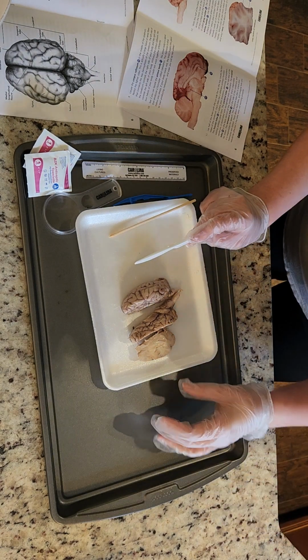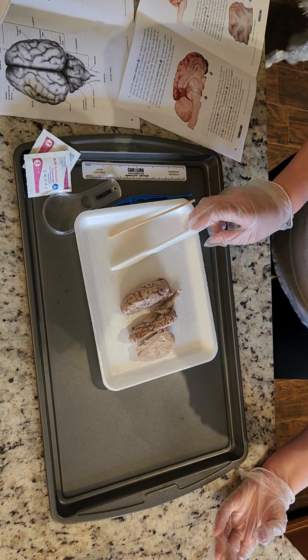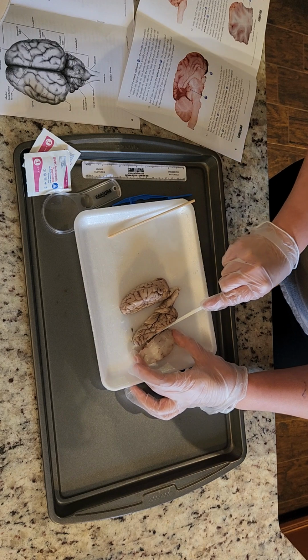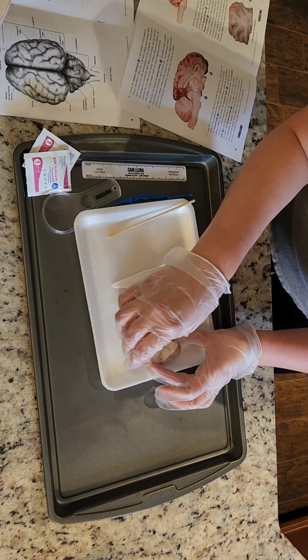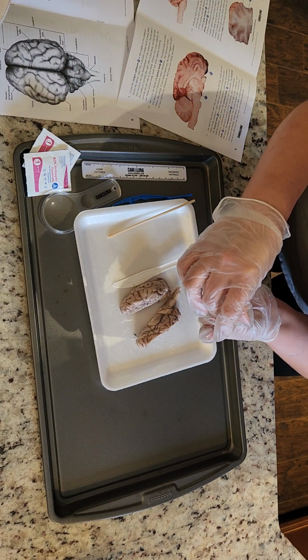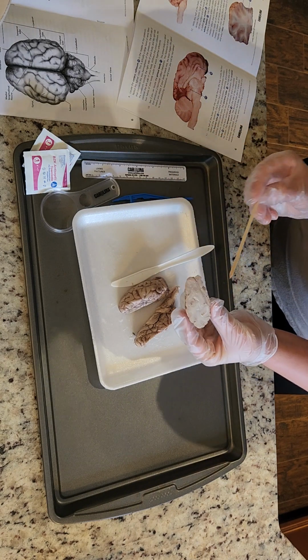I've got some light shaded sunglasses on for eye protection, so I'm trying to see if I hold it into some better light, I can see the white and gray we're talking about. Let's see. Oh yeah, I can see it. I just had to shine it in the light a little bit.